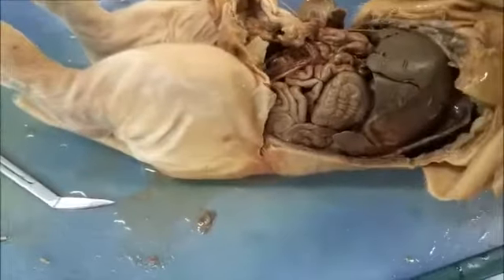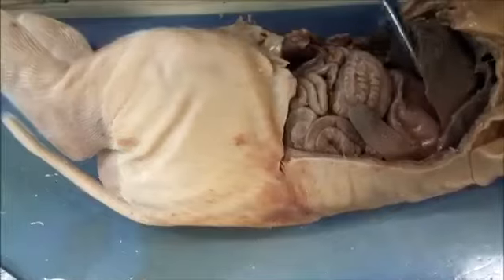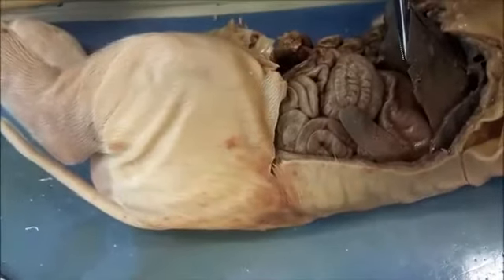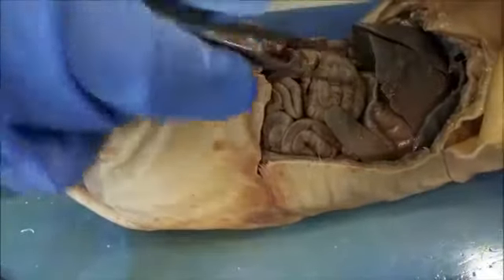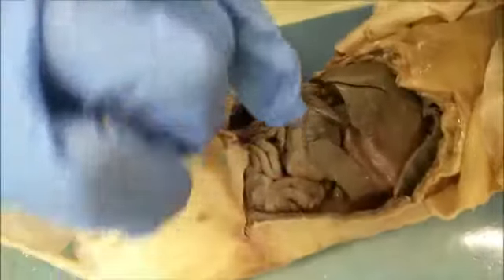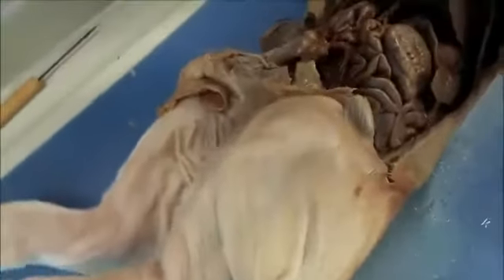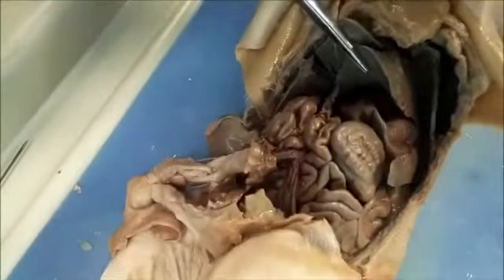And the stomach? The stomach is back here. It is for digestion. It has a low pH of around 1. And you have muscles within the stomach wall that give it mechanical digestion as well, as opposed to a chemical one. Then from there it'll go through the intestines and have secretions mixed with it.